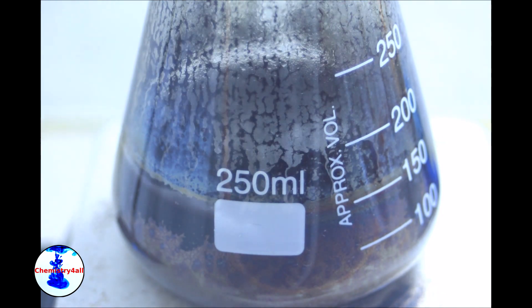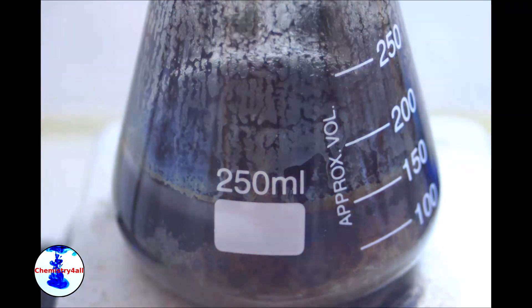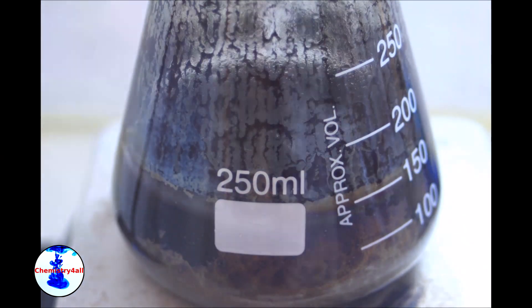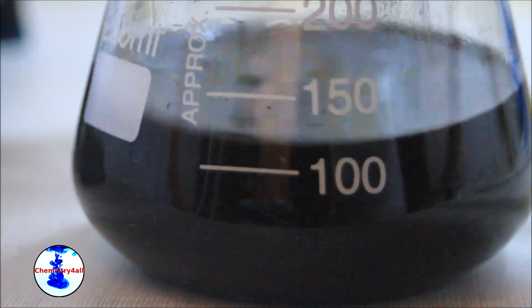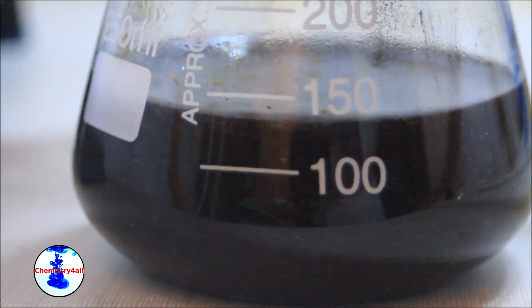Once the reaction is finished, the system is allowed to cool down to room temperature. This is the final reaction mixture. You can see that there is no permanganate left and that a nice brown to black precipitate, corresponding to manganese dioxide, has appeared at the bottom.